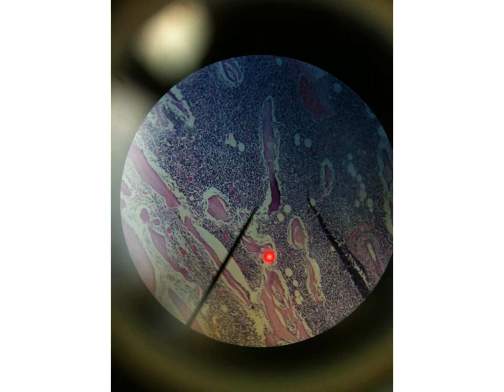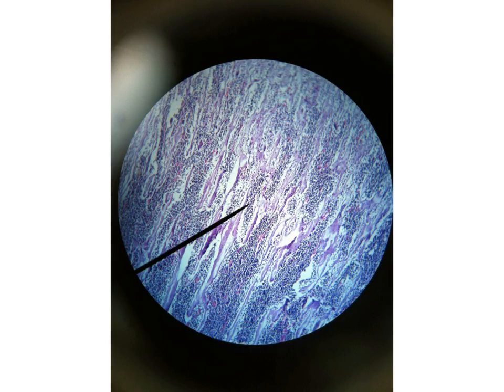In another slide, you can see here in the middle of the growing bone the presence of spicules of spongy bone, and in between them we have the bone marrow cells. In another slide also you can see here the spicules of the spongy bone separated by the bone marrow, and of course they are longitudinally cut.